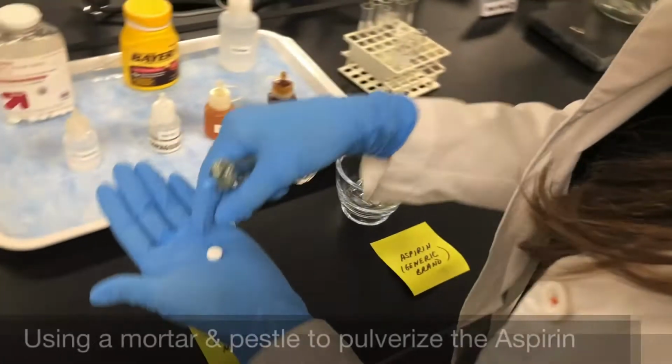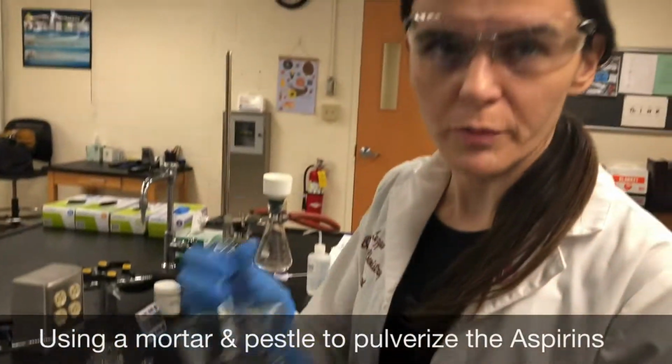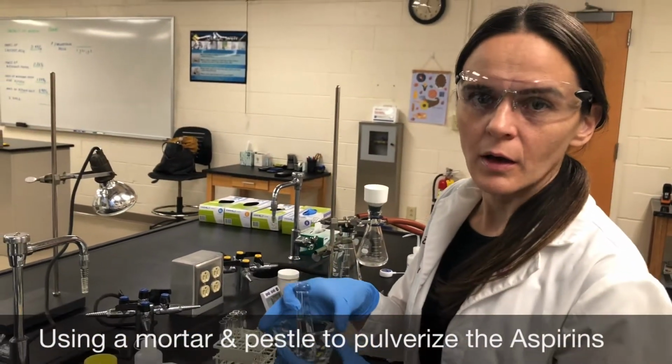My commercial aspirin is in tablet form. I will use my mortar and pestle to pulverize it, or turn it into powder.